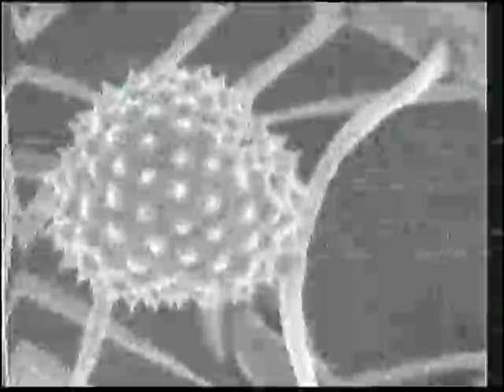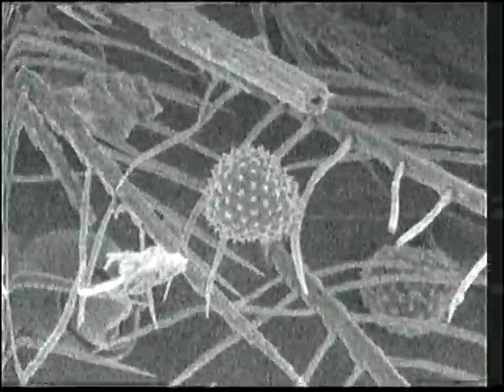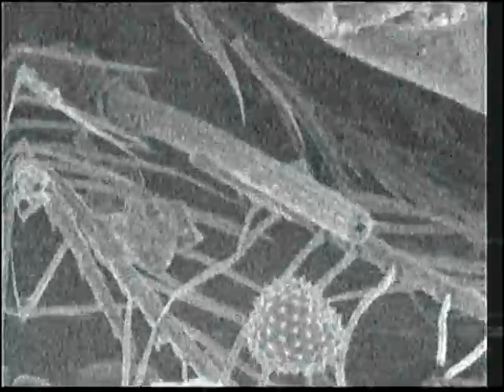And so here's some pollen grains. So if we were pollen enthusiasts, we would know what part of the country this spider lived. That's the highest magnification that this can go to, which is 9,000 times. It goes to 9,000x. The diameter of a pollen grain, I think, is something like 10 microns or so. I think. There's a broken hair.